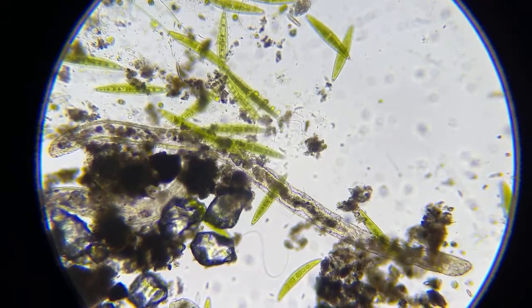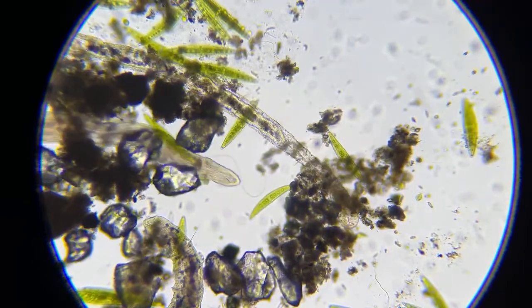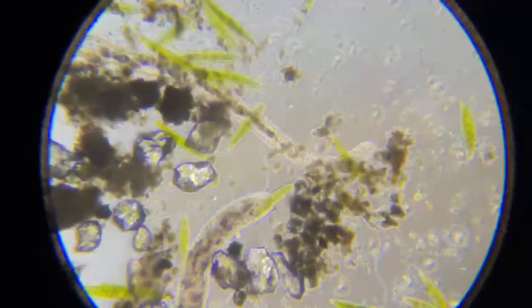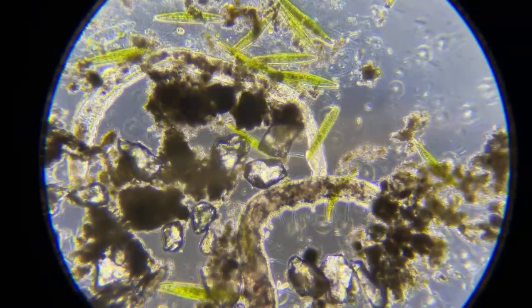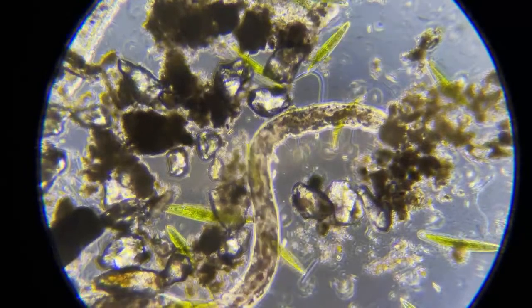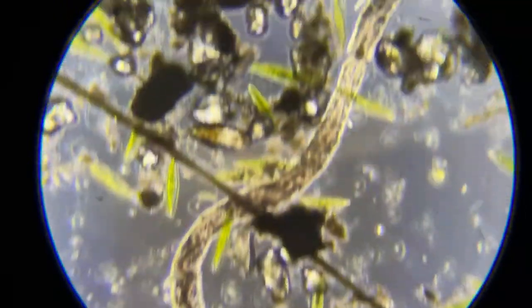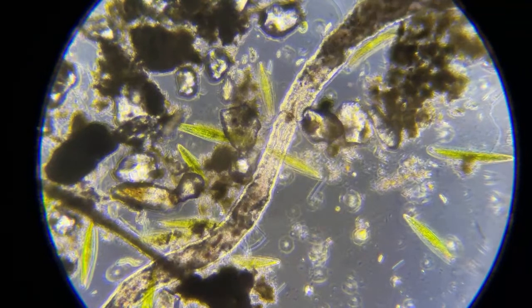And all that dark stuff in there is stuff that they ate. And while he's being still, let me try to grab my phase contrast on here real quick. Sometimes with phase contrast, you can see their insides better. Yeah, you see how it's moving? You can almost see it circulating with phase if they'd stay still. The one downfall is phase contrast: when things are moving, you want to pull your hair out.